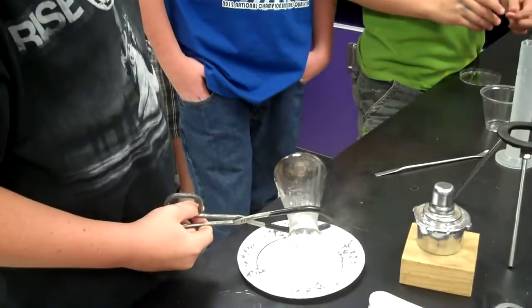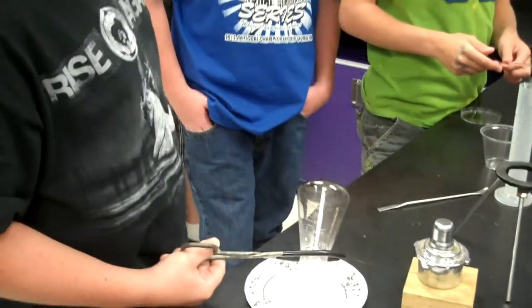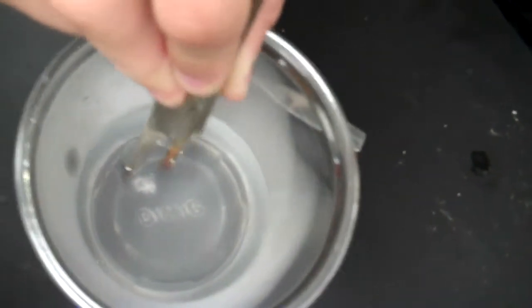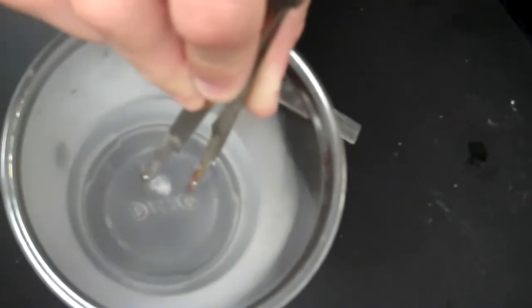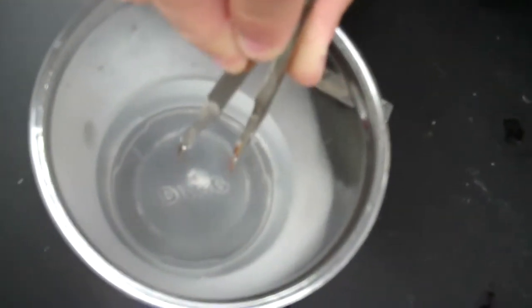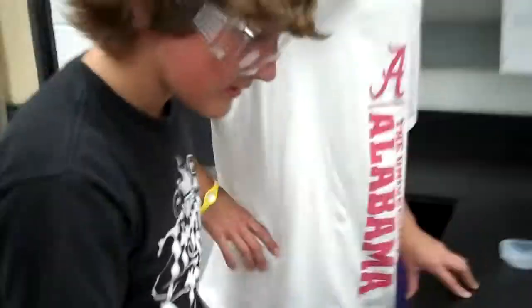Okay, look at this. Preparing Seed Crystals. Excellent. So here we are trying to get the Seed Crystal properly positioned. How's that looking? Good. That's looking great in the center. Beautiful. Good work.